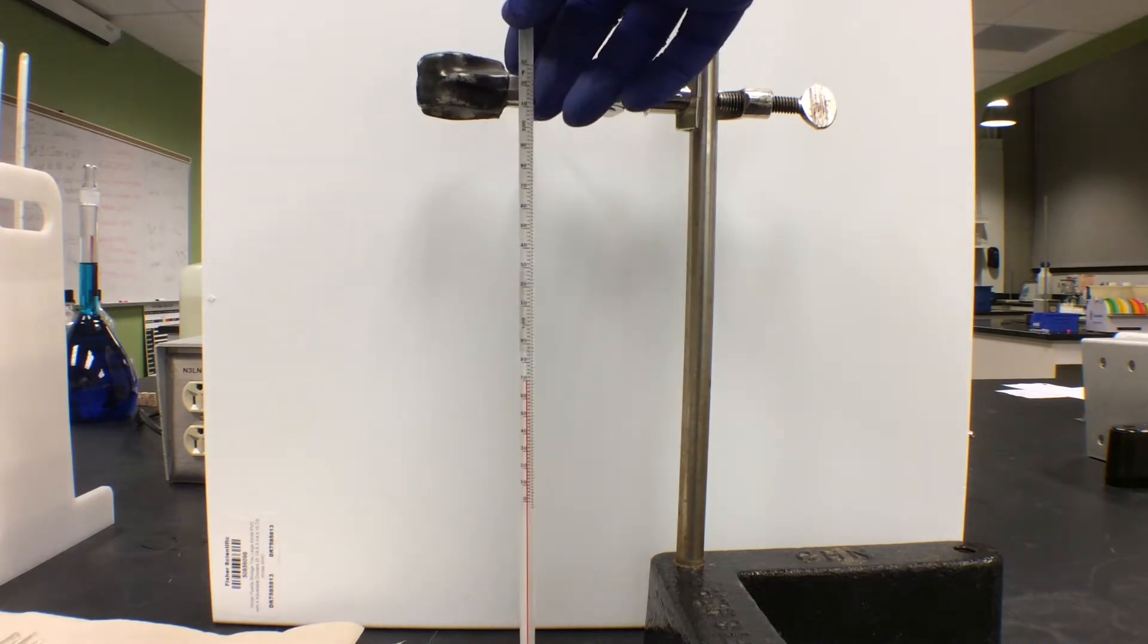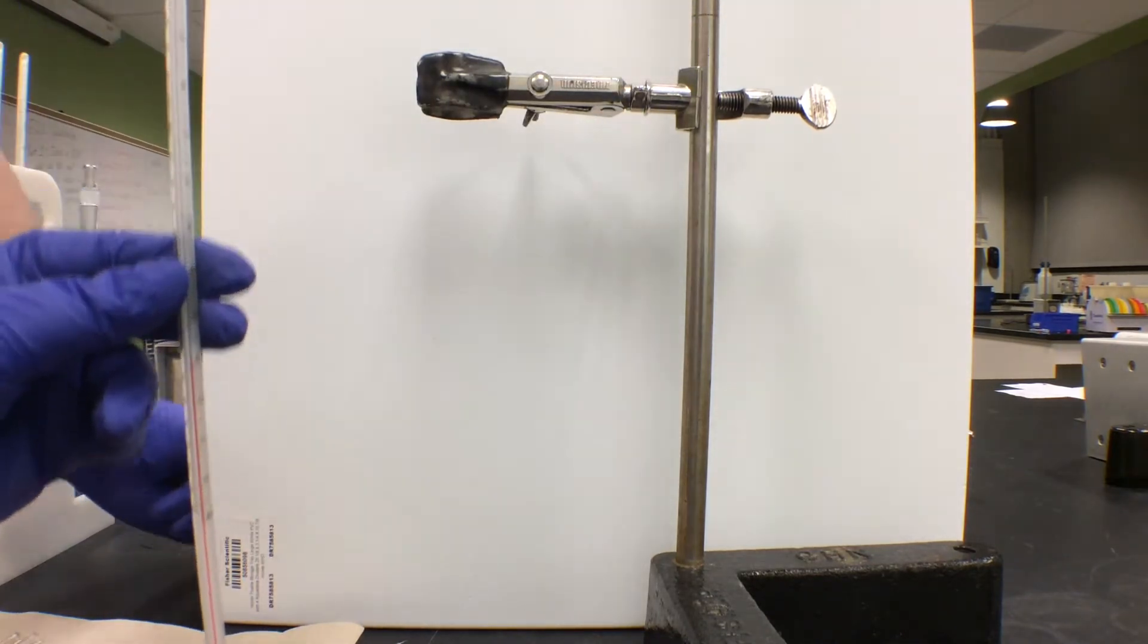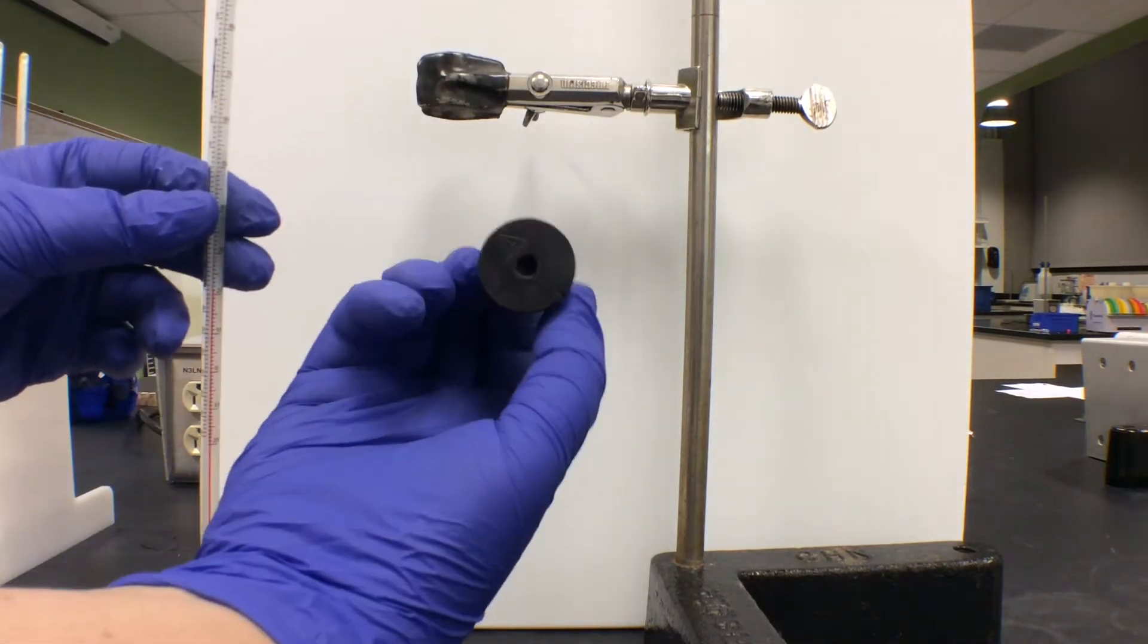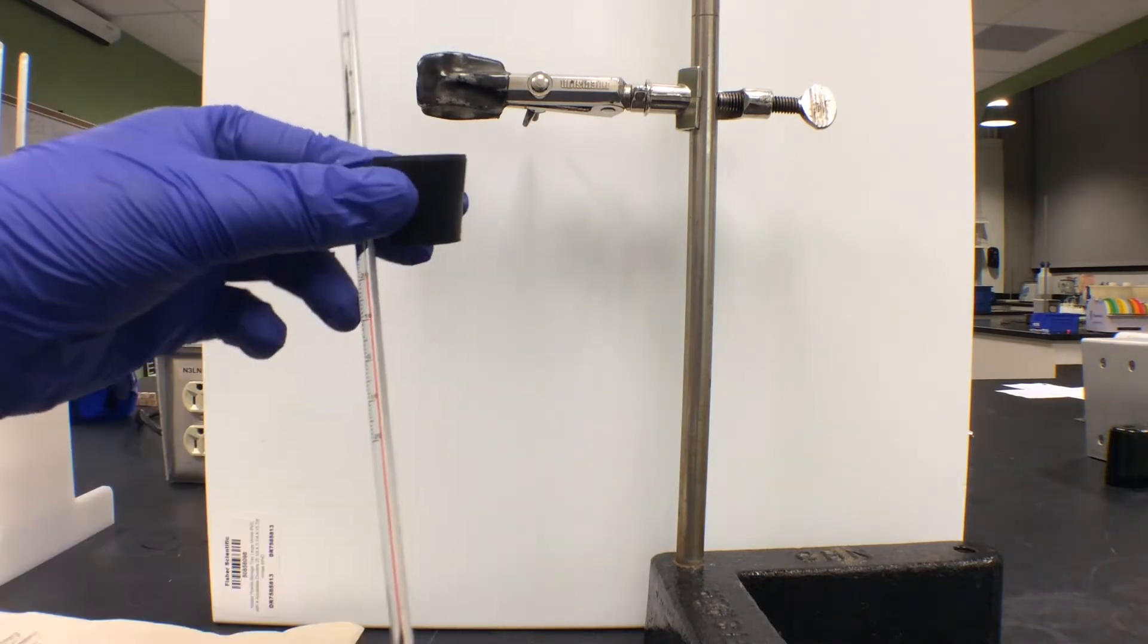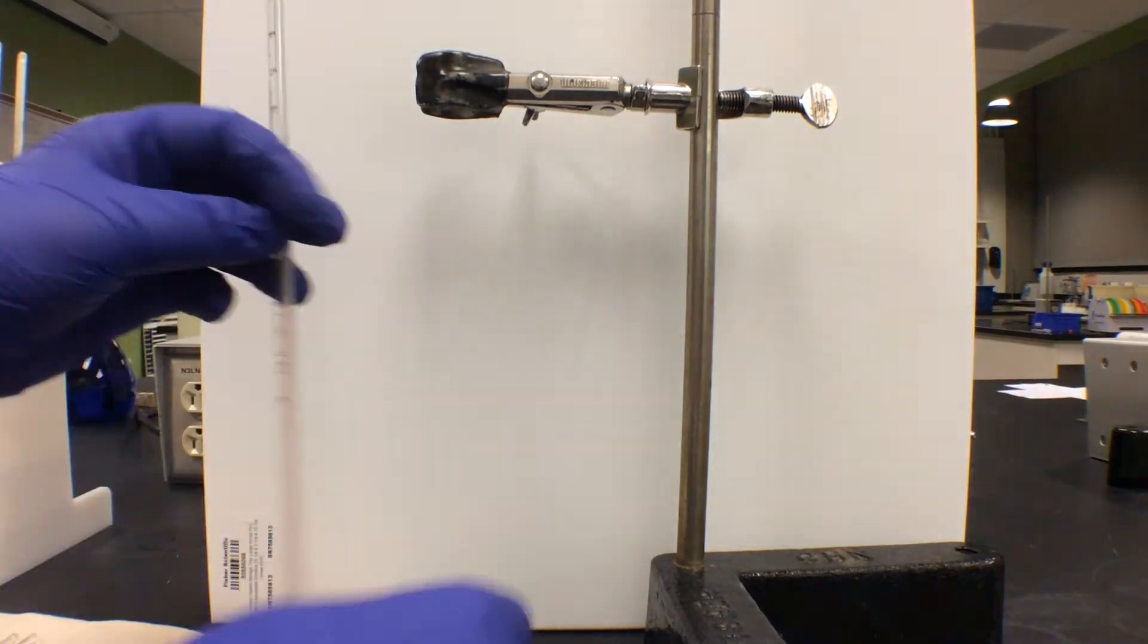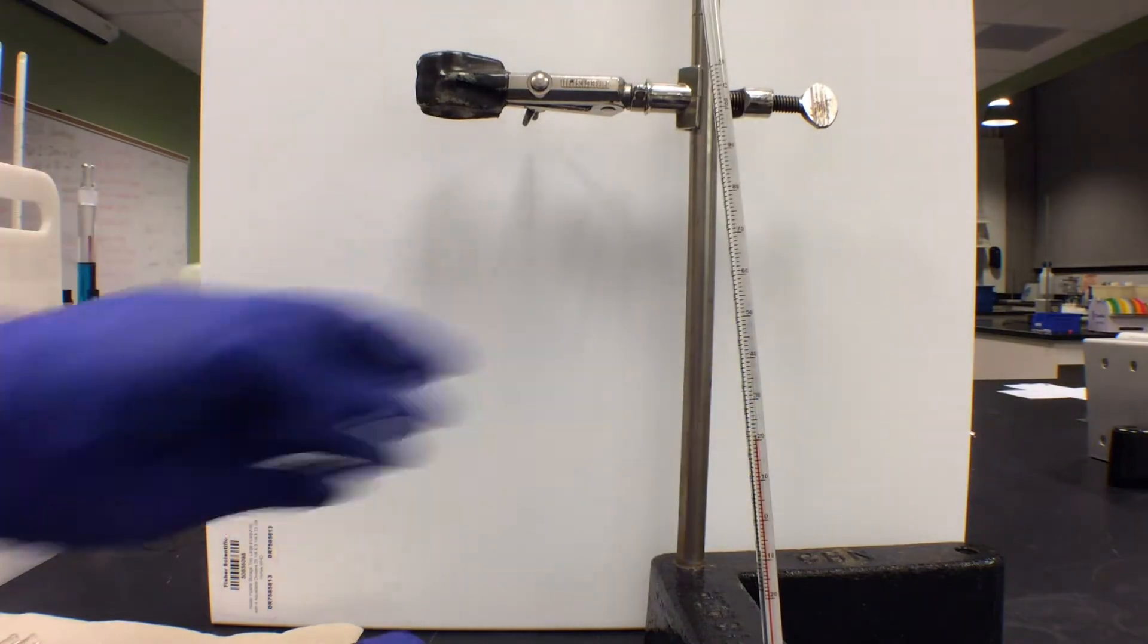Here's our thermometer, and here's our rubber stopper. Make sure you never lay your thermometer down. Always keep it upright.